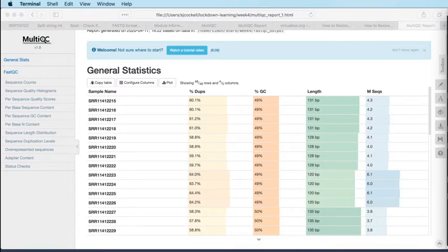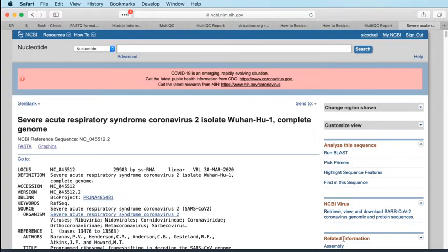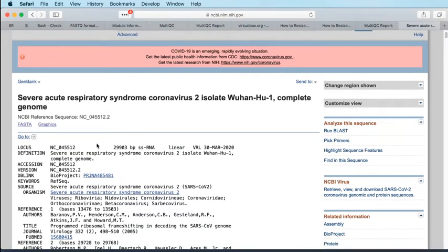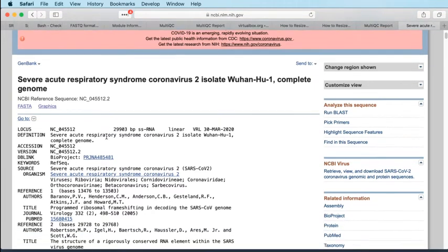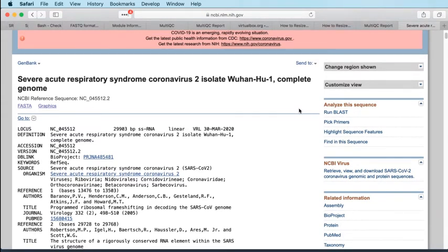There we are. Right, bear with me a second. There we go. This is the NCBI. This is the GenBank entry for the SARS-CoV-2 genome. So it's about 30,000 bases. And it's NC_045512. So that's the viral genome, should anybody be interested. Okay, which I'm sure we will come back to. We're going to map to the human transcriptome, but it might make sense to map to the viral genome as well at the same time.